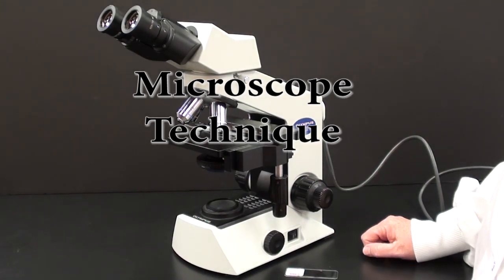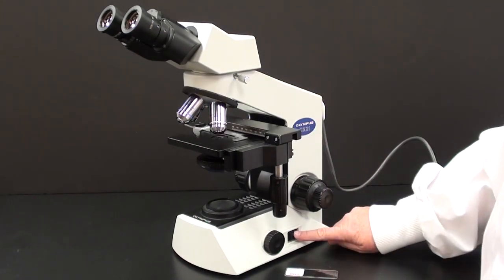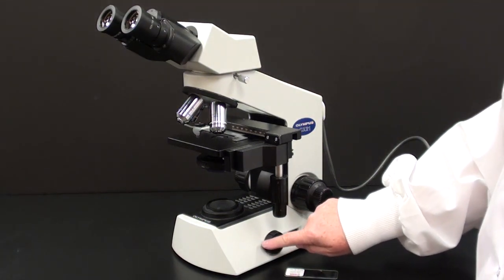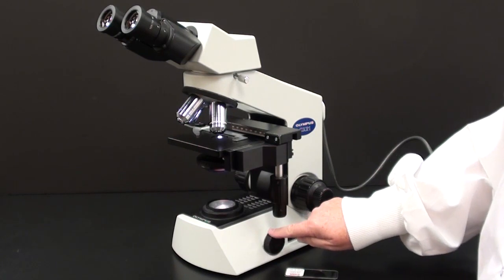To begin using a microscope, plug it in. Turn it on. If no light appears, turn the light adjustment knob.